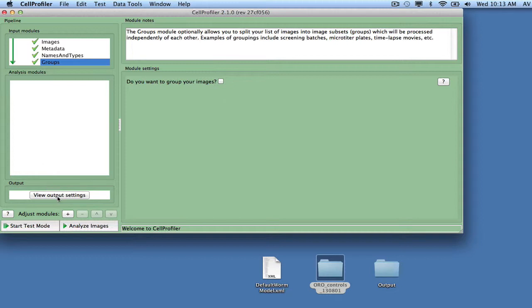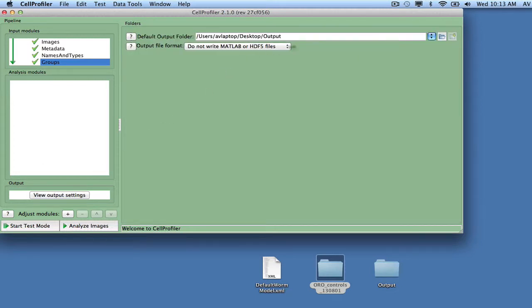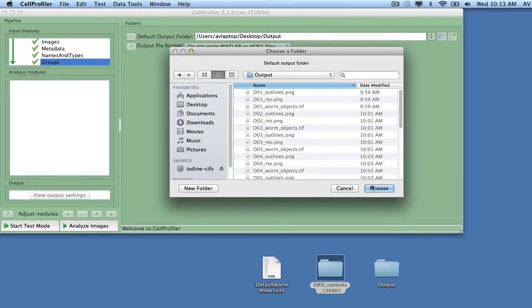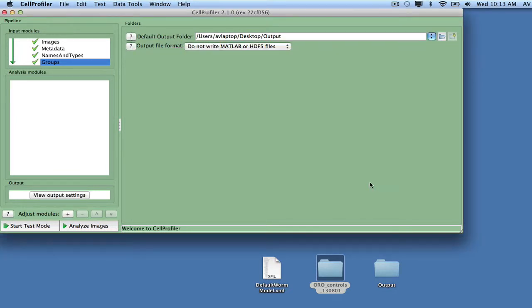In order to save the worm model, you will need to adjust the output settings. Click on the View Output Settings button in the bottom left of the CellProfiler interface and then adjust the default output folder to point to the folder where you want to store your output.